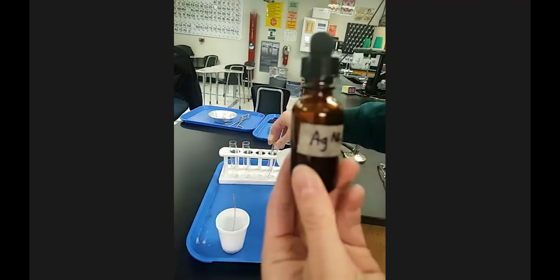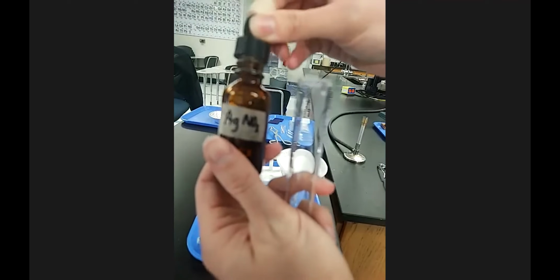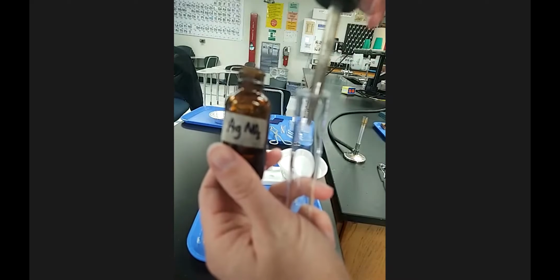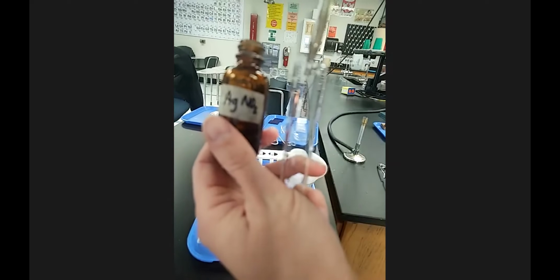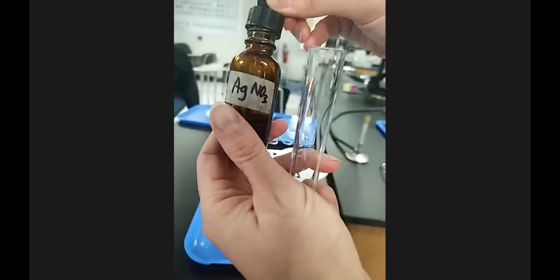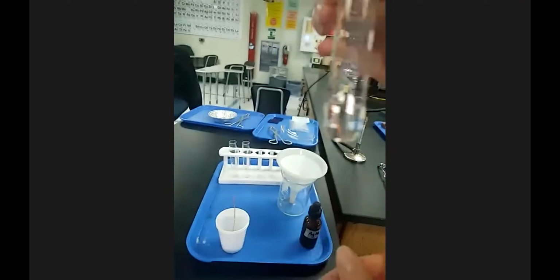And so I'm going to add some silver nitrate to the test tube with the copper wire. You would just add a little piece and a dropper full. I'm going to add a few dropper fulls so you can get a little bit more. But the directions say just add 1 or 2 dropper fulls. You don't need a lot of something to see a reaction. I'm making this reaction, putting more in than you would, so that you can see it a little bit better.